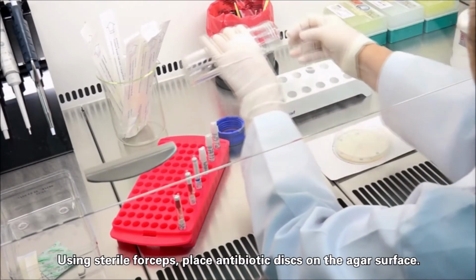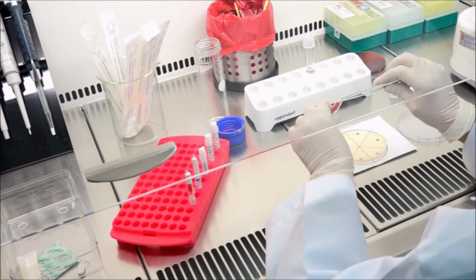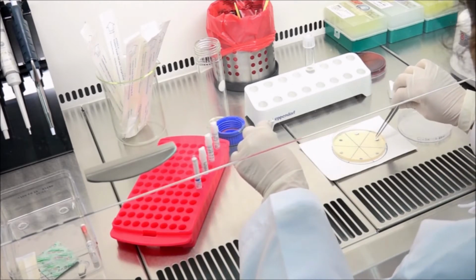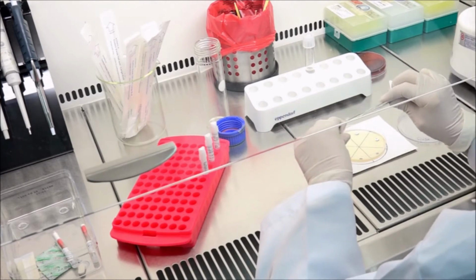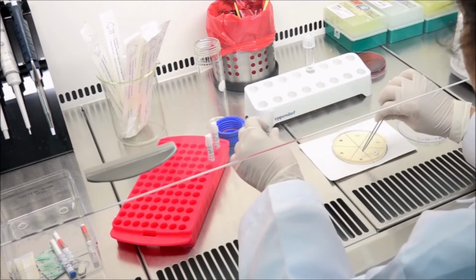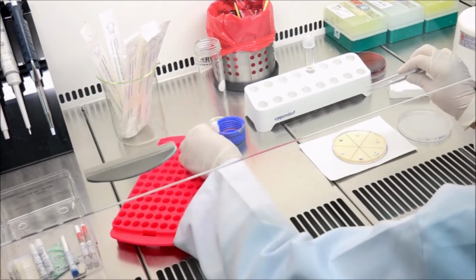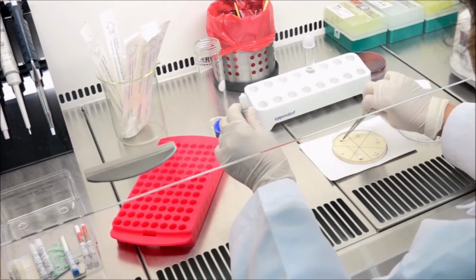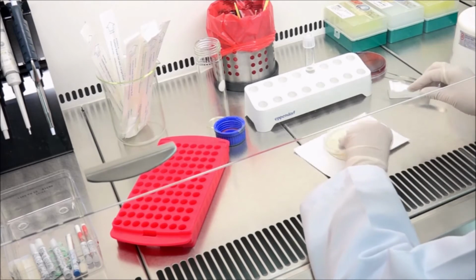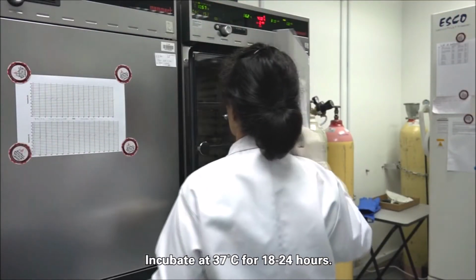Using sterile forceps, place antibiotic discs on the agar surface. Incubate at 37 degrees Celsius for 18 to 24 hours.